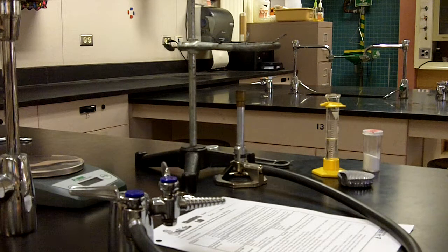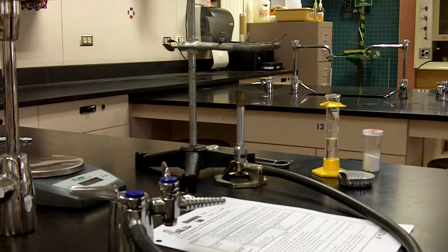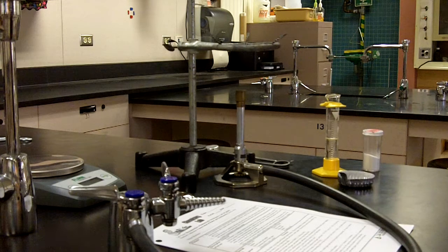Hello and welcome to the makeup lab for unit 6, the decomposition of baking soda and stoichiometry lab.